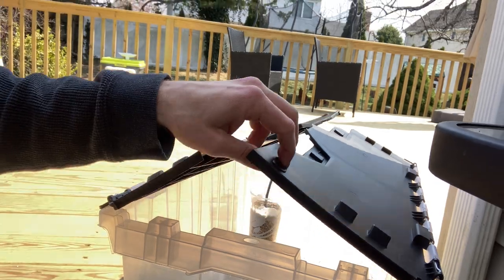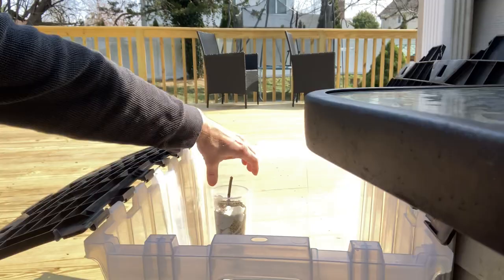You would let this sit for another couple of weeks. Once your cuttings have fully developed roots and you start to see some top growth, you can then remove them from the cups — either slide them out or break the cups. You could then plant them into larger containers. You're probably going to want to cut your potting mix, so maybe 50-50 with potting mix and perlite, let them grow a bit longer, then up-pot them later to something closer to 100% potting mix. Really easy, simple system. He does this for hardwood cuttings starting with the damp paper towels, but for softwood or semi-hardwood you can skip that step and go straight into cups.